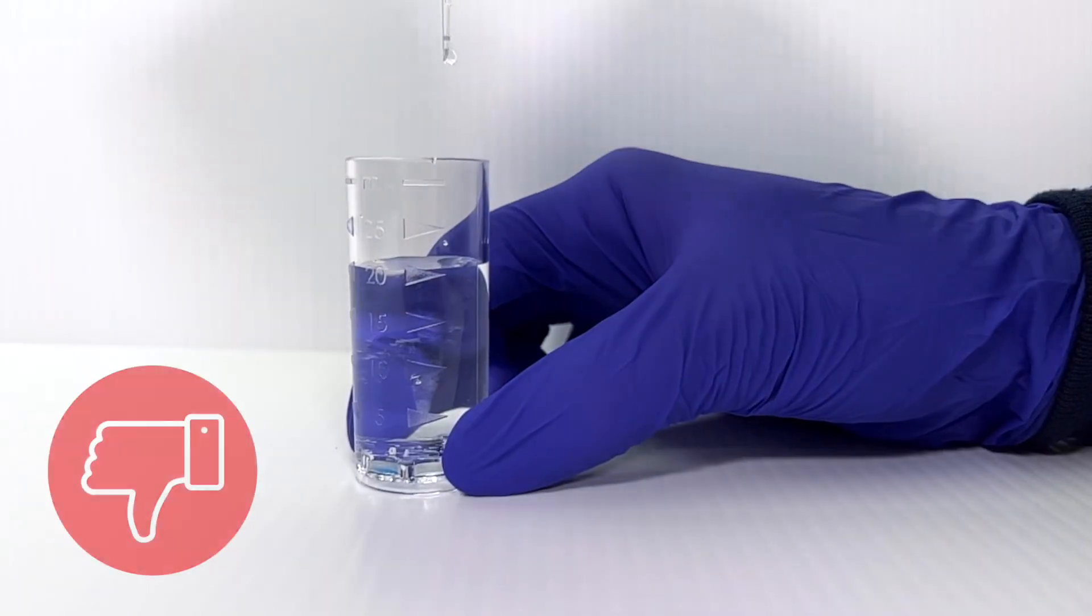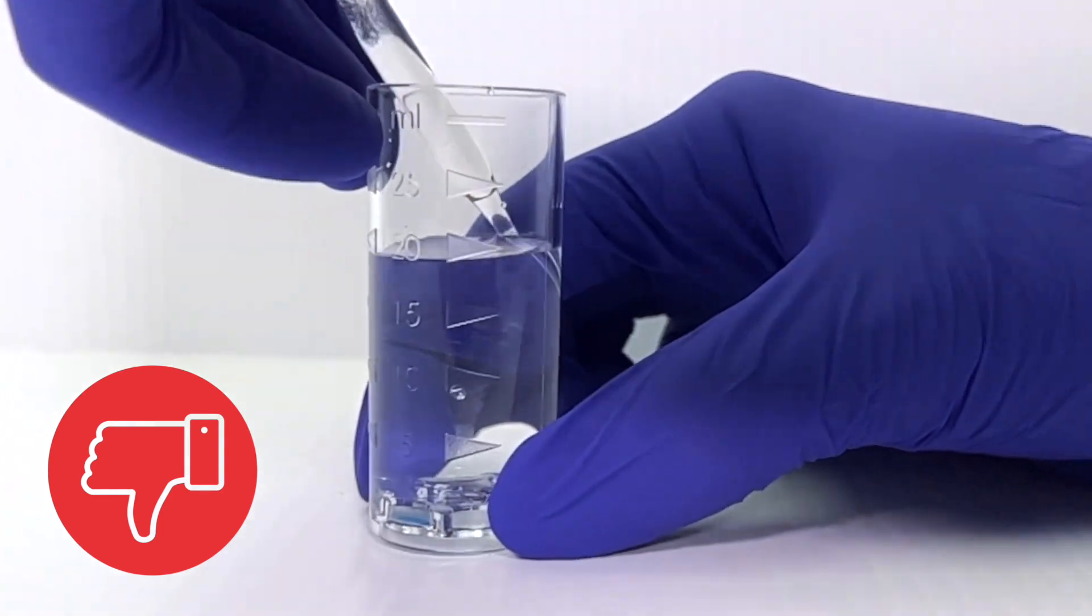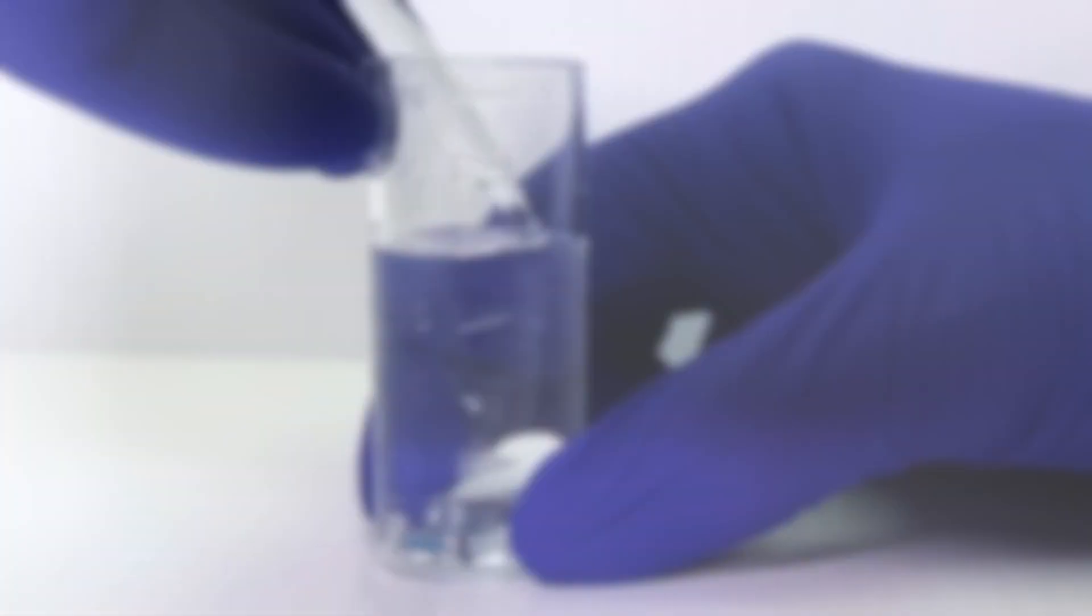It's also not advisable to only partially insert the ampoule and attempt to break the tip against the sample cup side wall.